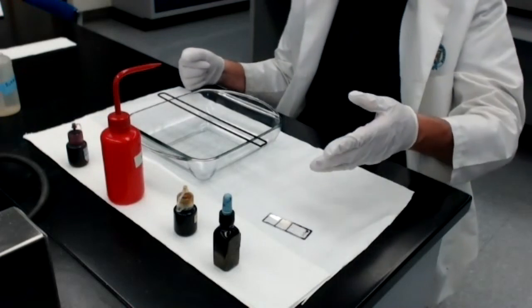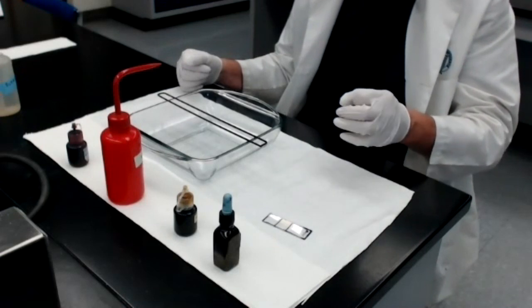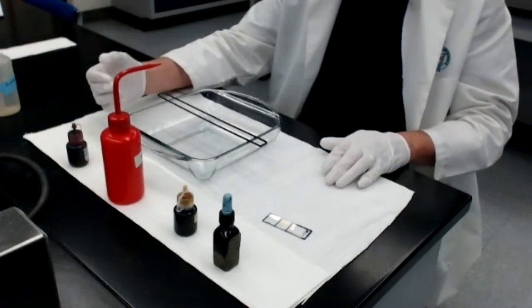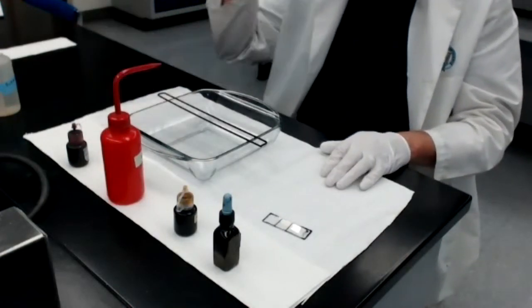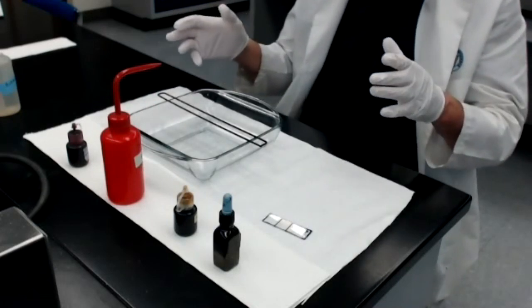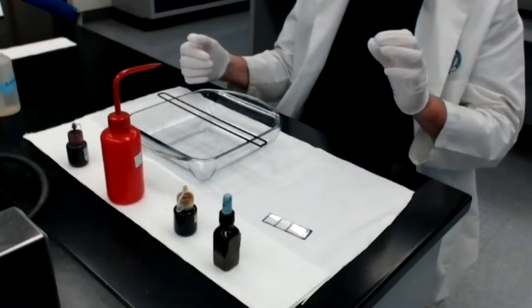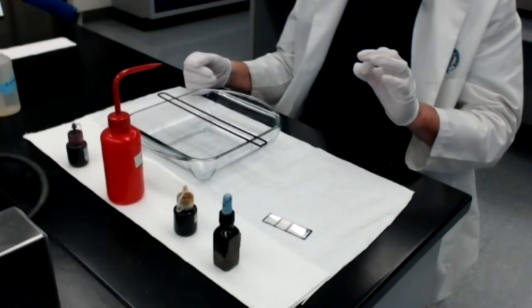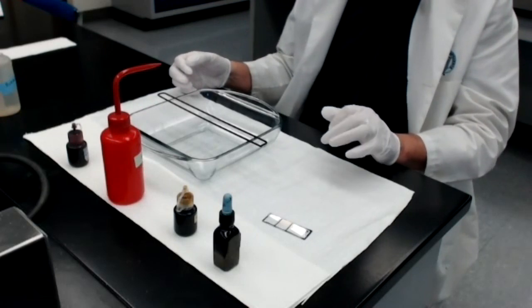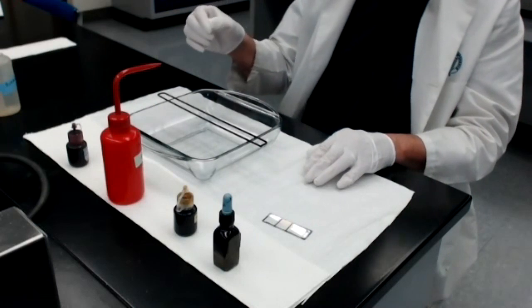Now, as you already know by this point of the course, bacteria can have different shapes. Staphylococcus is a coccus. It has a spherical shape. And E. coli is a rod and has a rod-like shape. So at the conclusion of the gram stain, I should not only be able to see that the Staphylococcus is purple and the E. coli is pink, but I should see that the purple bacteria, the staph, are spherical, and the E. coli, which will be gram-negative, should be rods.